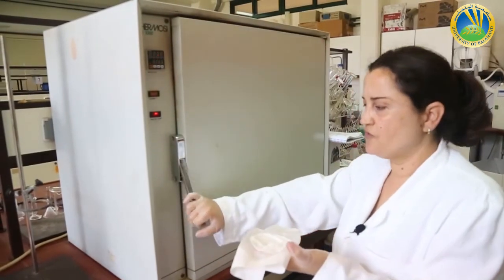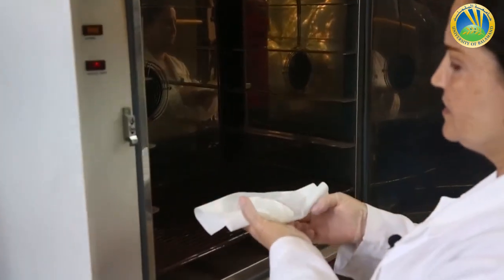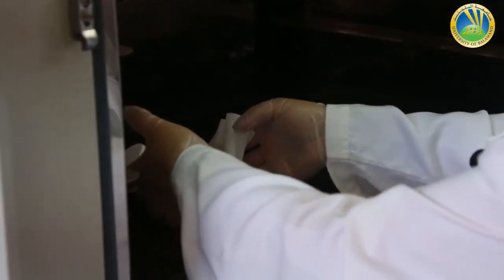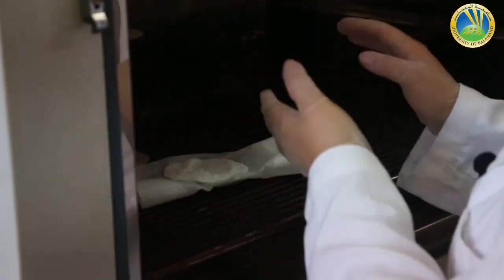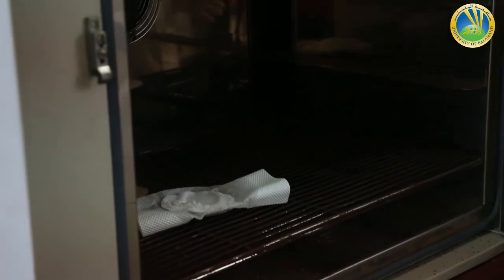So I have to let it dry inside the oven for like two hours at 60 degrees and then I have to weigh it again to get the weight of the crystals.